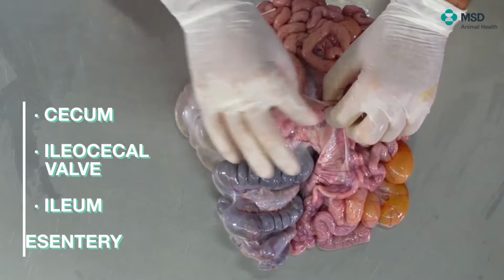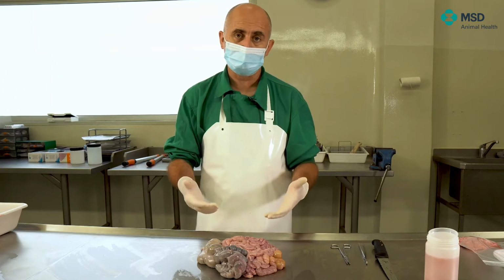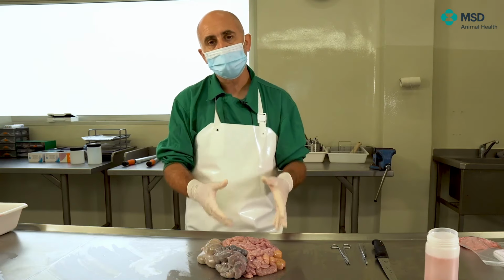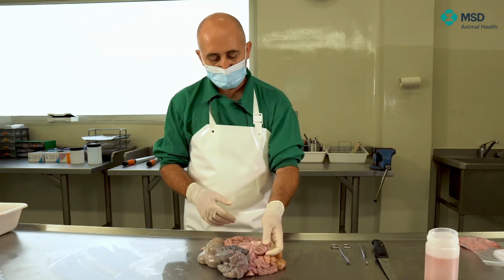Remember that Clostridium difficile can affect the large intestine, especially the colon. E. coli, of course, causes different forms of post-weaning diarrhea. So the type of samples that we need could be, in most cases, bacteriology, in some other cases PCR, etc. And of course, histopathology can help as well. So we will decide which is the best one for each disease.